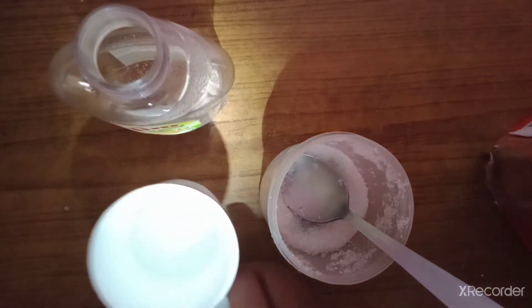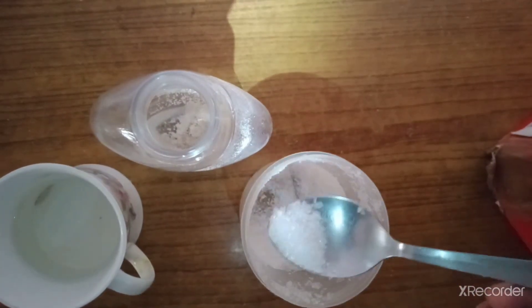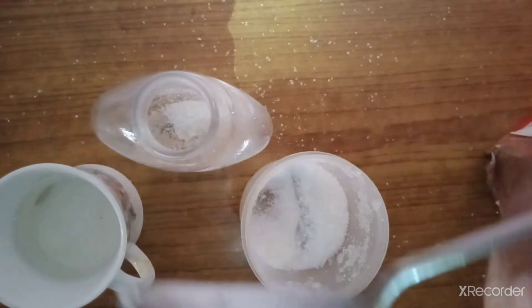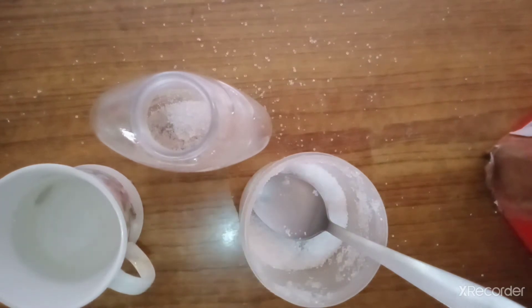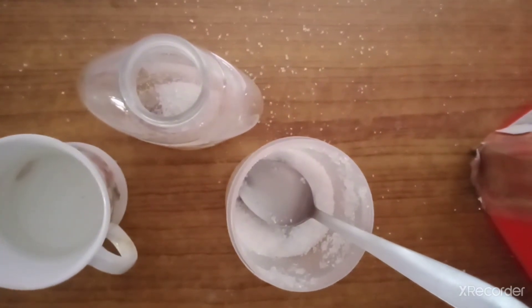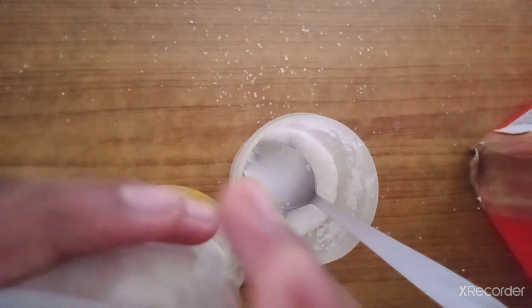I have already poured the yeast powder in. Now I will pour only a little sugar — not much, just a little. I have poured a little sugar. After that, I will pour the lukewarm water into it.